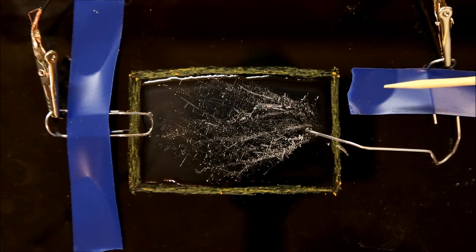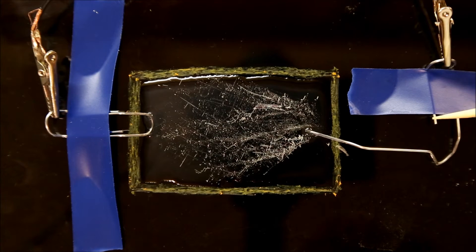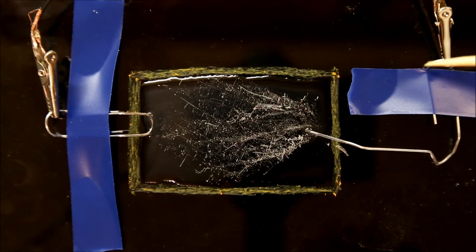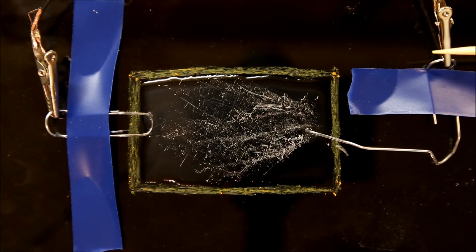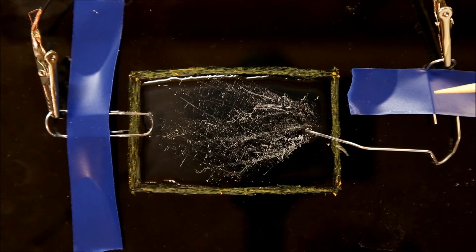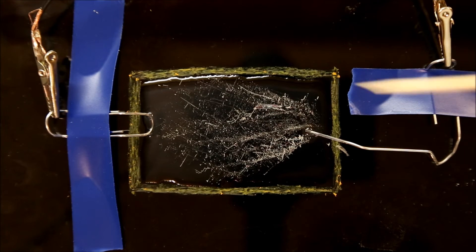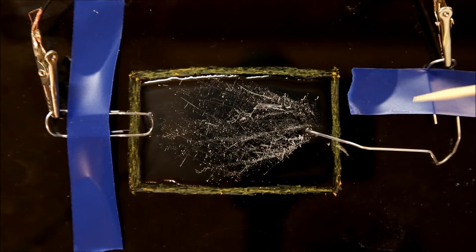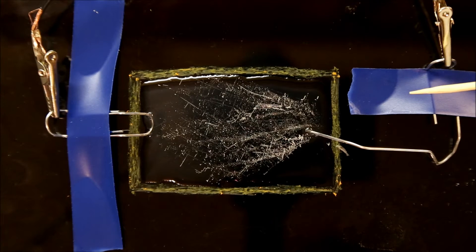I used just some electrical tape to hold the electrodes in place so they don't wiggle around, and a couple of alligator clips on a power supply to provide the electricity. The tape is nice because it removes easily so that you can clean the plate of glass off between growth periods.